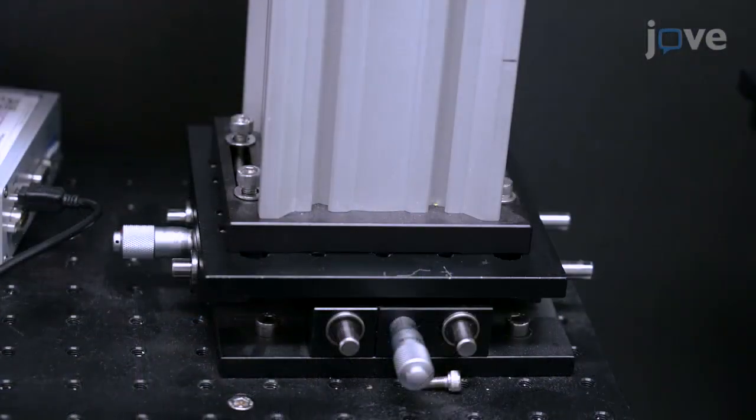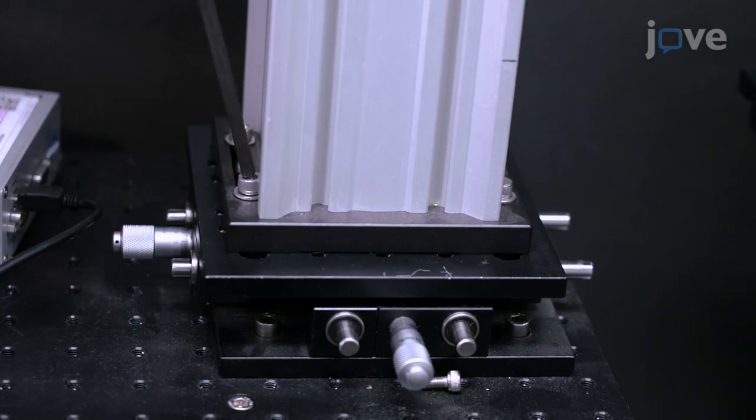Vertically mount a motorized linear stage with more than 20mm travel length on a manual XY stage to build a translation stage for magnet manipulation in 3D.